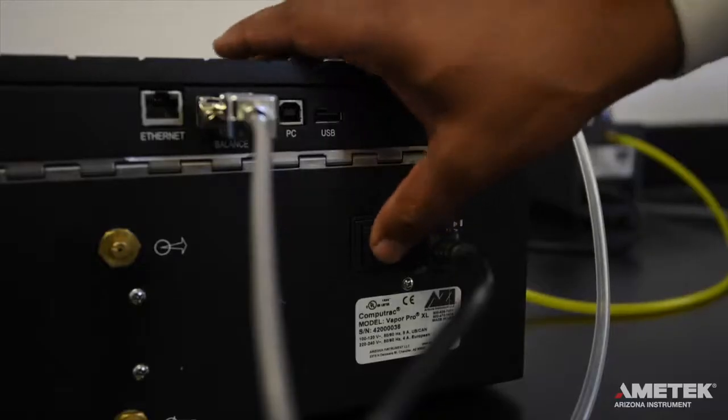Now that everything is connected properly, it's time to turn on the instrument. Flip the power switch on the back of the instrument to the on position. If a balance is connected, turn it on as well.